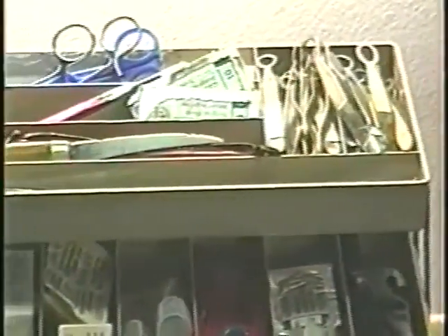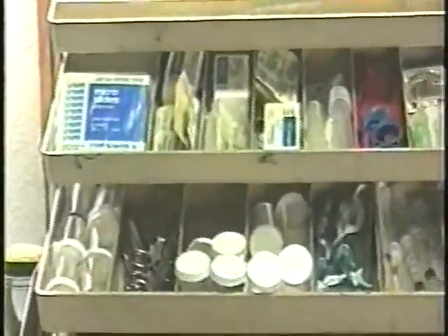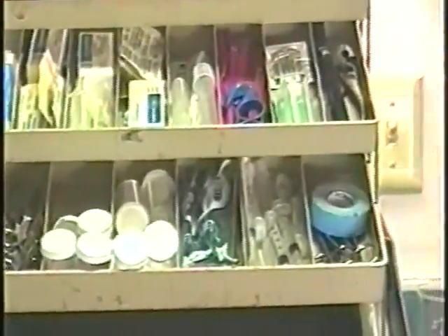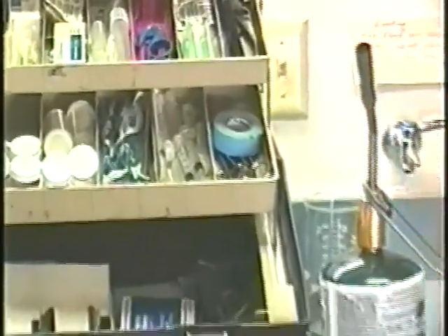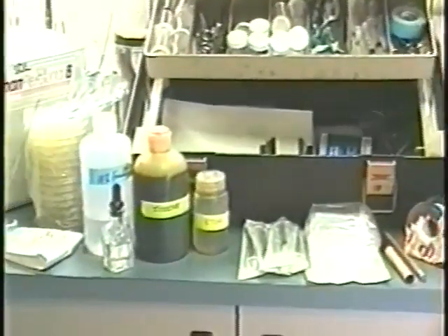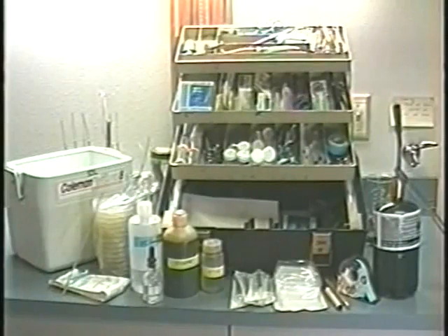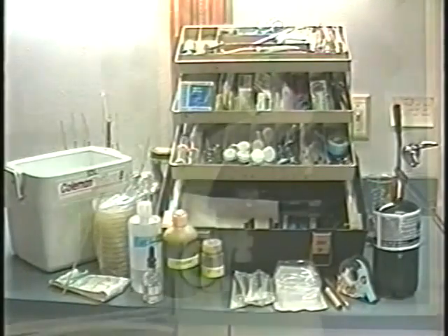Supplies should be readily available, and a suitable necropsy kit would contain a variety of forceps, scissors, scalpels, and blades, small butcher's knife, alcohol and a burner for sterilizing tools, iodophor or other disinfectants for cleaning the work surface, paper towels, glass microscope slides and cover slips, fixatives, bacteriological media, containers for samples, pencils and pens for labeling, and ice or refrigeration if samples need to remain cold for transport.